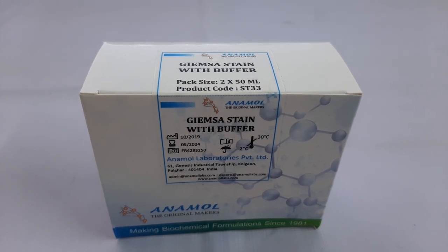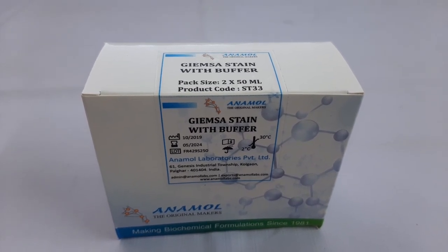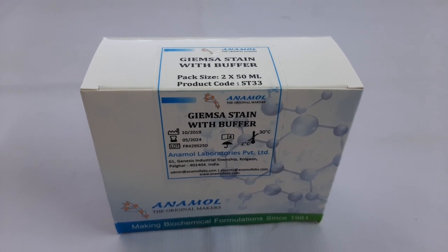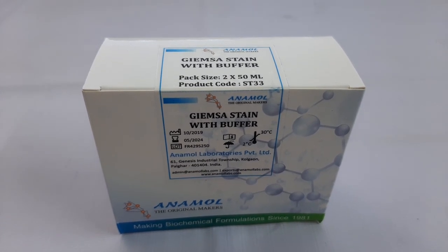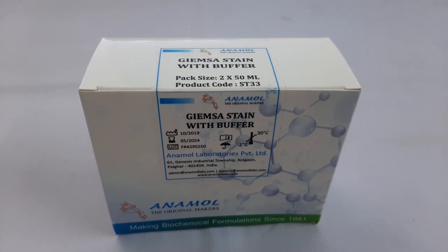Hello everyone. In this video tutorial, we will see the working and procedure to perform Giemsa stain with buffer using the kit manufactured by Anamol Laboratories Pvt Ltd.